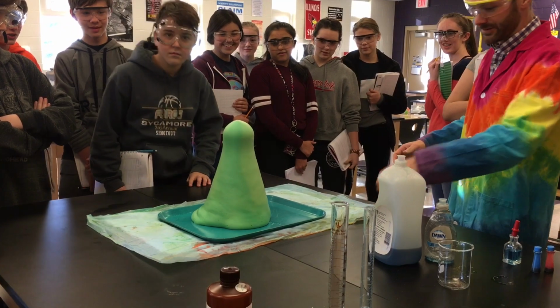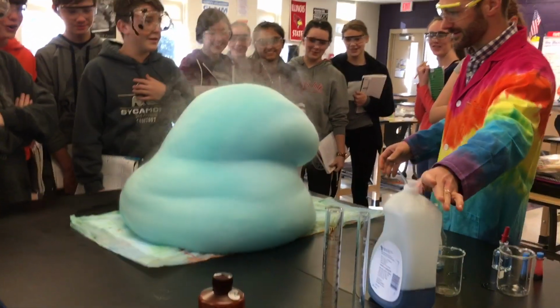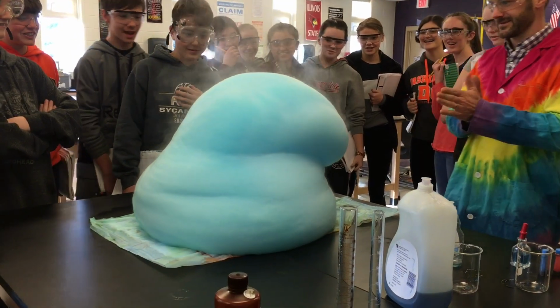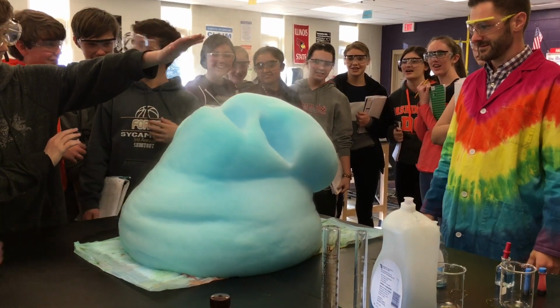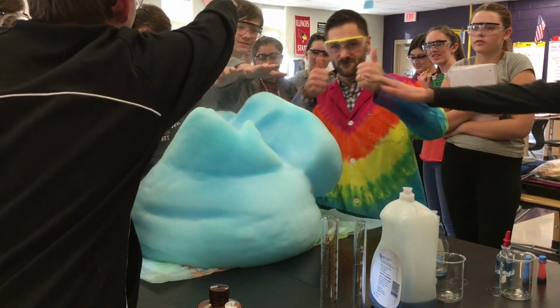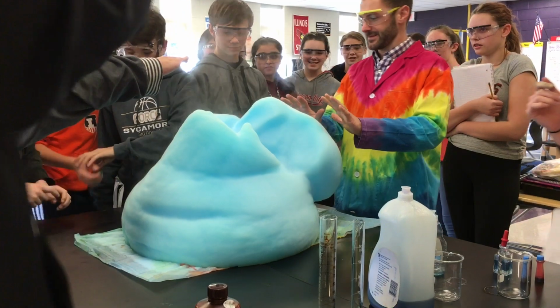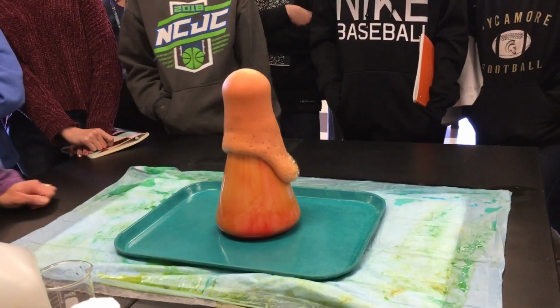Just since this is 30%, we get a little bit more of an intense reaction. And it picks up speed, and steam is released, which is water. And also we get a lot of heat that you can see some students are starting to feel now. Now you wouldn't want to touch the foam because it might burn your skin, but at a safe distance we can feel some of the heat radiating off of there.